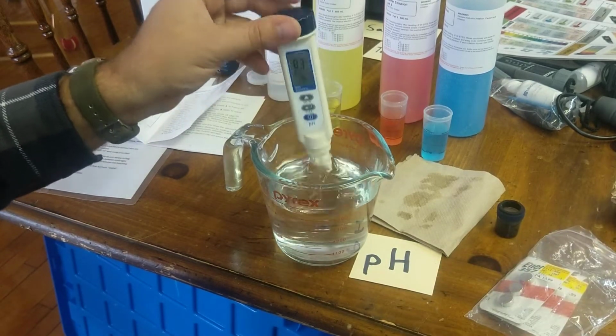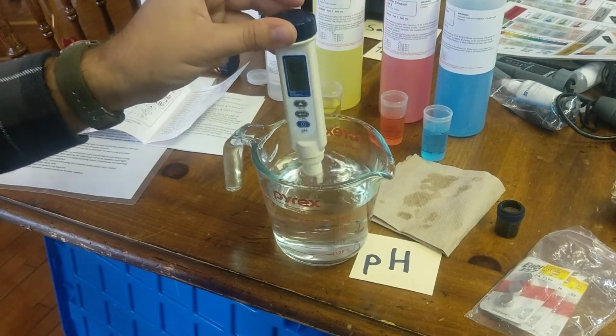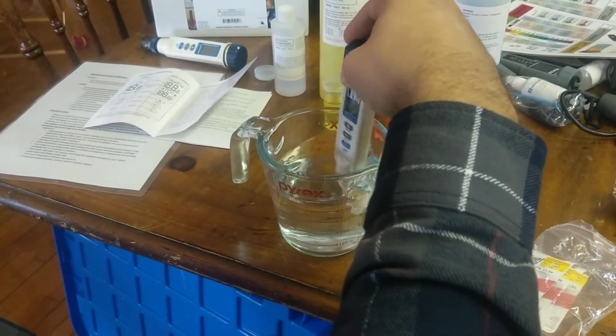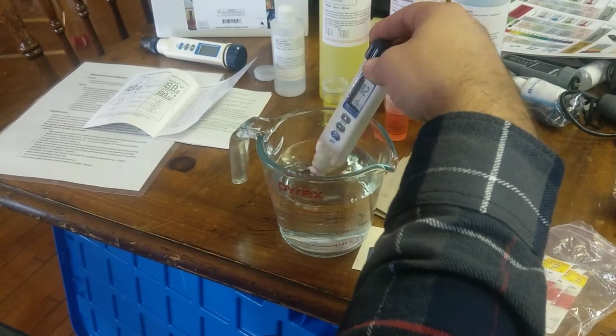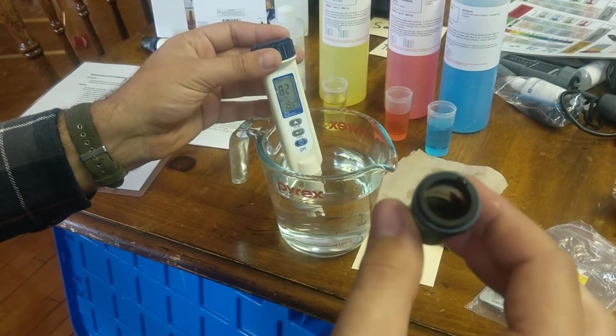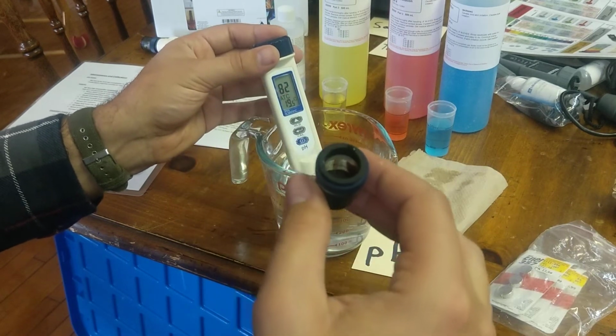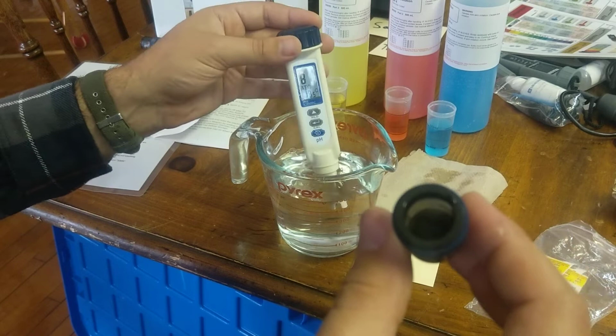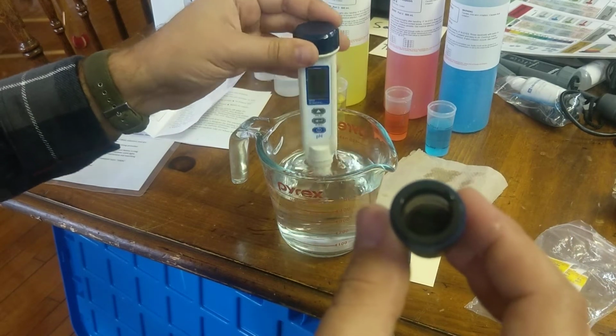But make sure it's rinsed off properly, and then you can store it properly over here with the cap. Again, put a few drops of the storage solution or a little bit more. Make sure that it's soaked and wet, and that way it's good to go.